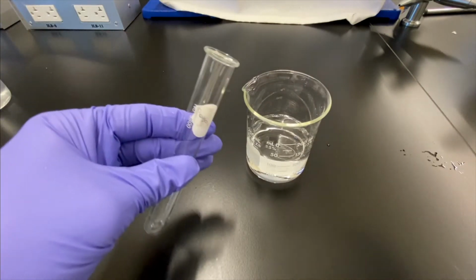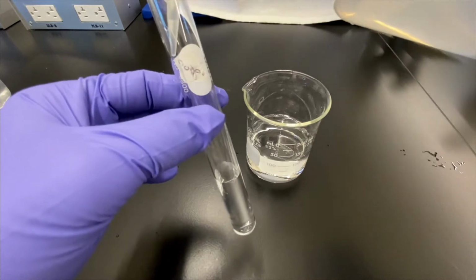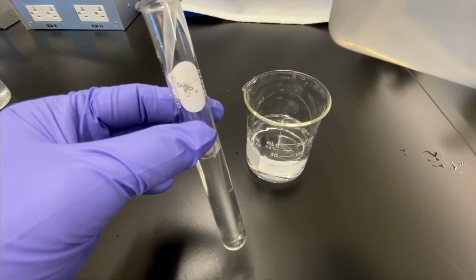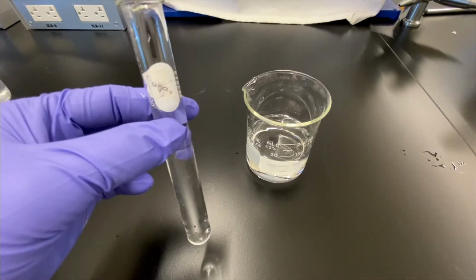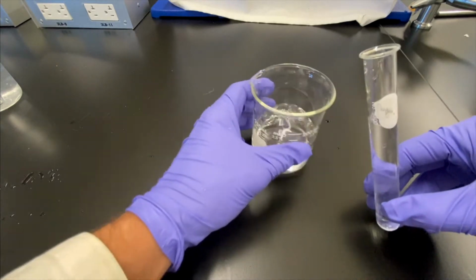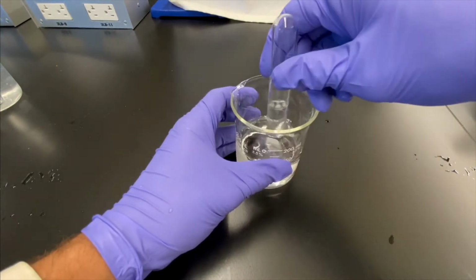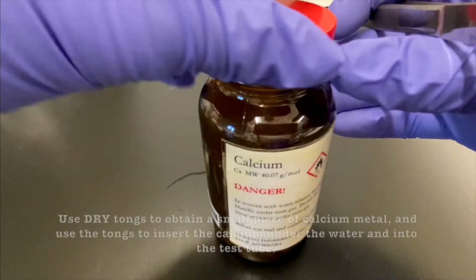And you'll see when we do it the reason why. It's a little tricky. All right, so about 3/4 of the way we'll do it. And here's the tricky part. All right, so see how we were able to trap some of the water into the test tube? And again, this will become evident in a few minutes why we did this.